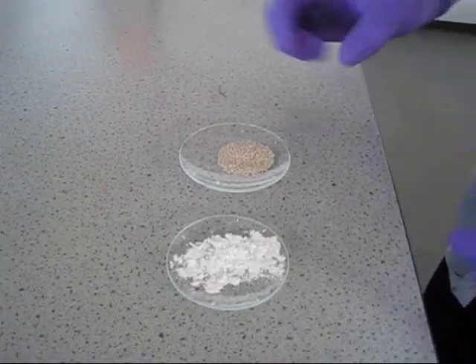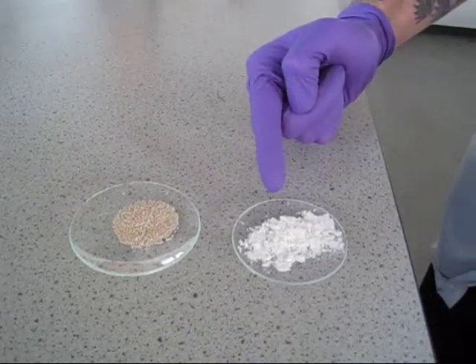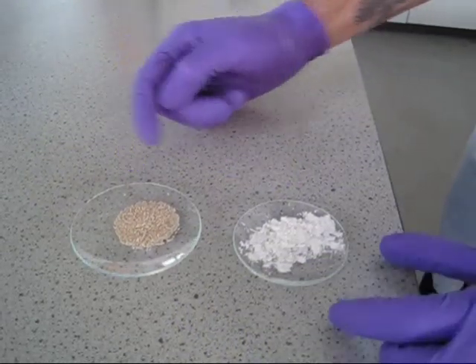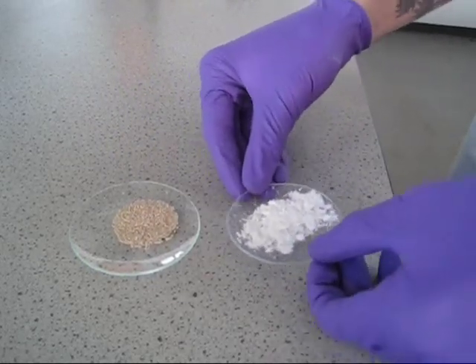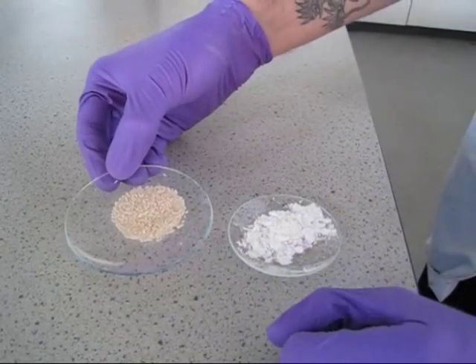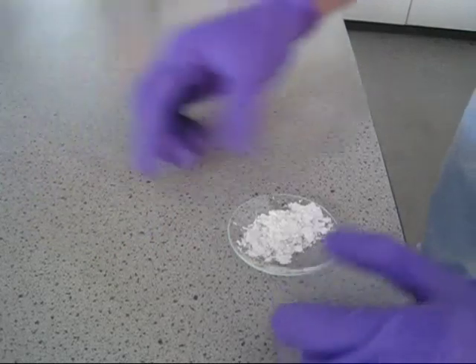Once we've finished our recrystallization, we can see the difference between our recrystallized product and our original product. Organic compounds, when they're pure, are white. However, you can see our original product is still dirty. Dirty and filthy. Let's not look at it.